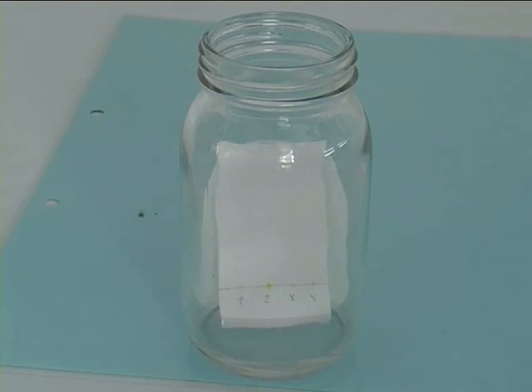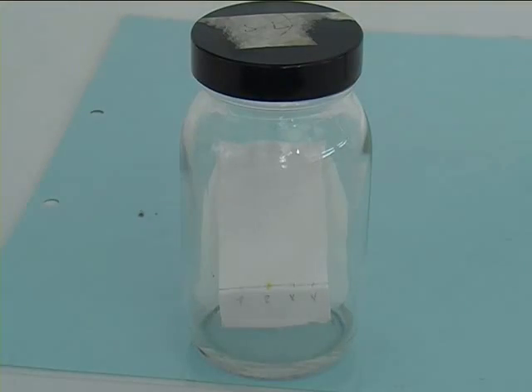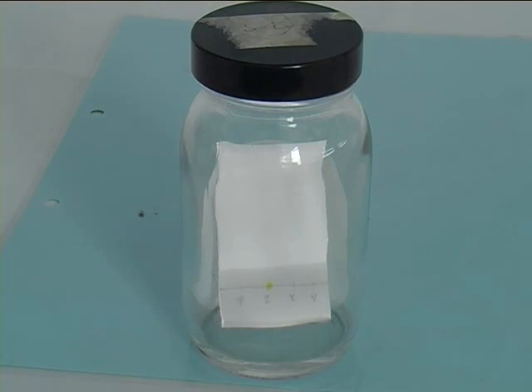Put it in, and you can see here it's very important that the level of the liquid is below the line of your substances, and then lets the liquid slowly move up the TLC plate.